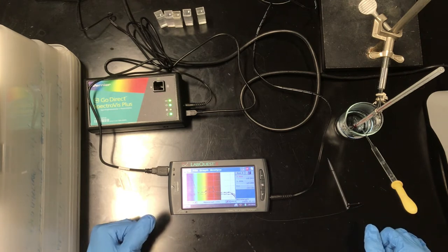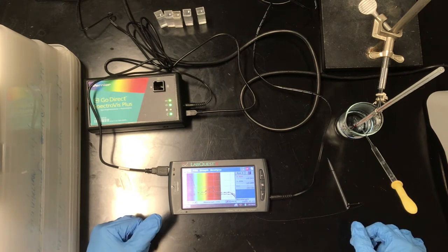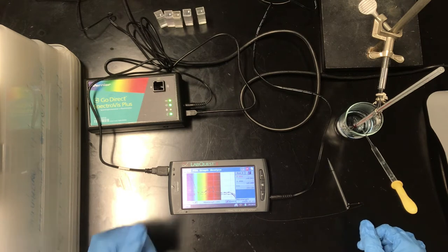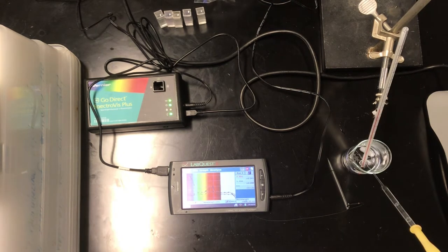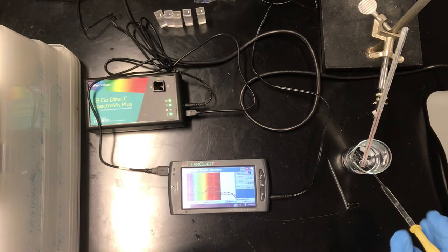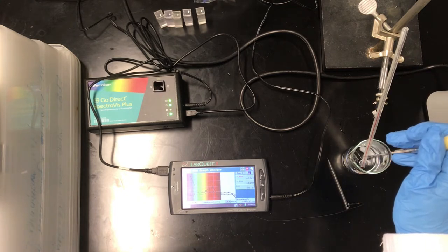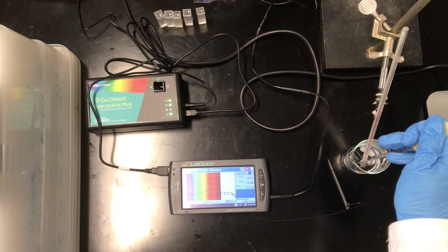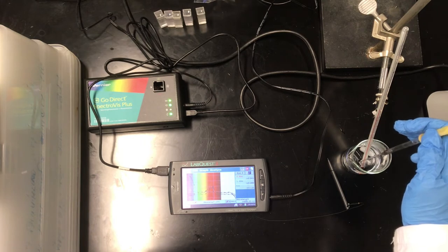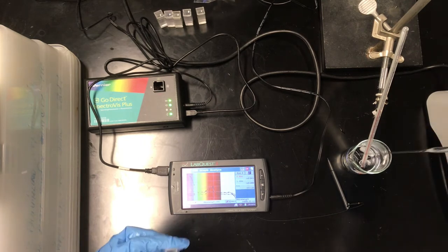Alright, so we'll wait a little bit for this to cool, close to room temperature, and we'll take yet another measurement. Okay, now we're down at about 27 degrees C, and I can't resist taking another measurement because I noticed a definite transition in the color and the introduction of a slight pink hue here.